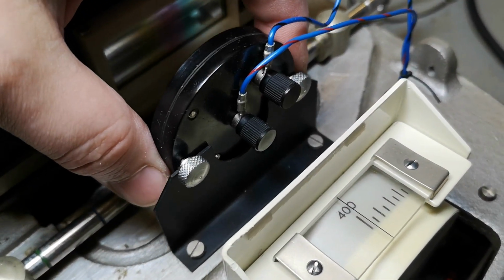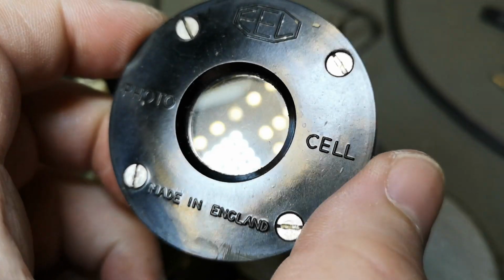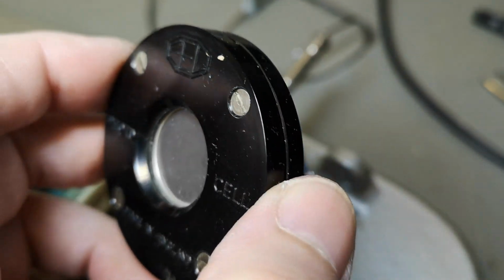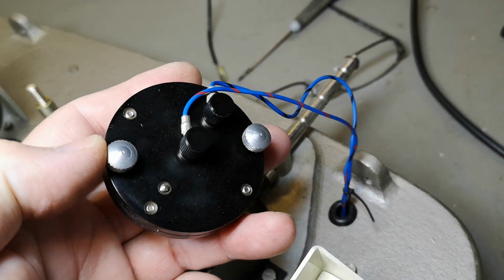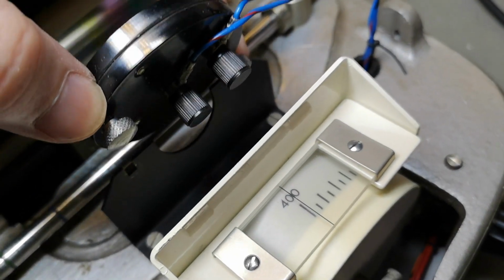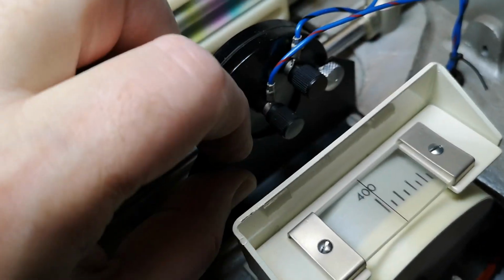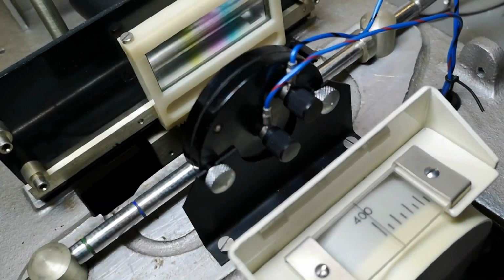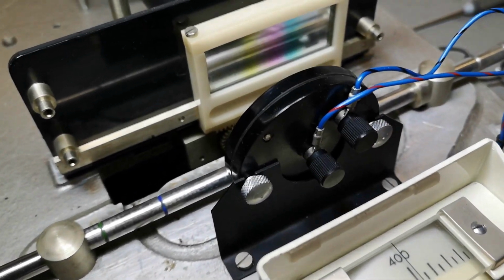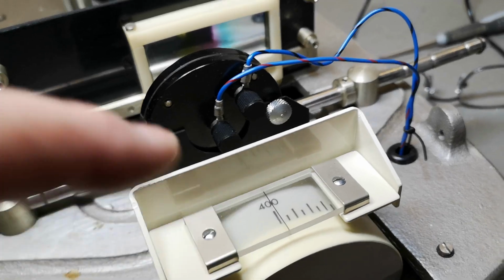So this is indeed a photo cell made in England. How cute is that? Can't really sit anywhere wrong. It can only be mounted the right way, so I do dare to poke a little bit with that, because I don't want to ruin the calibration, because it works.